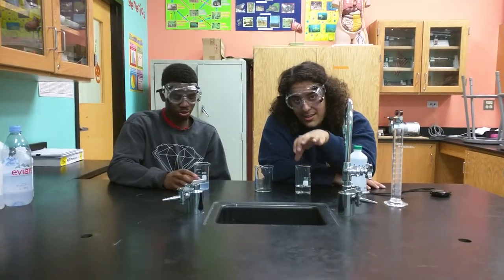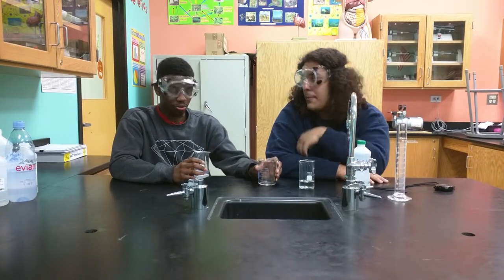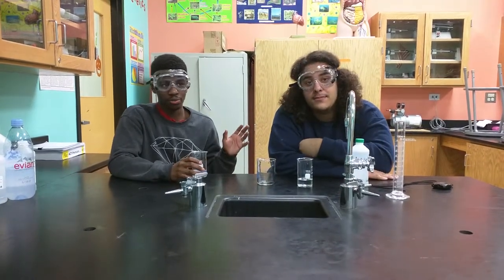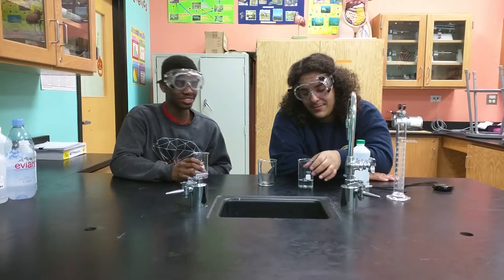So what we're going to do is mix both of these solutions into this container together. Something amazing is going to happen, but I'm not going to tell you — you guys should just watch.